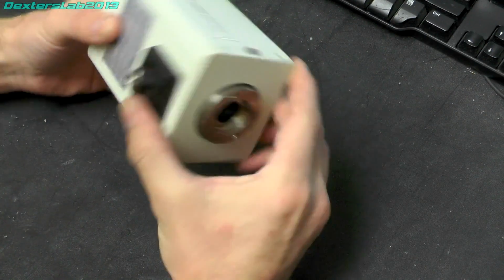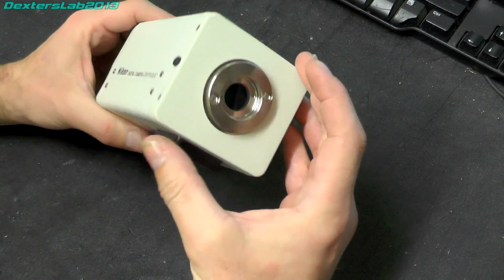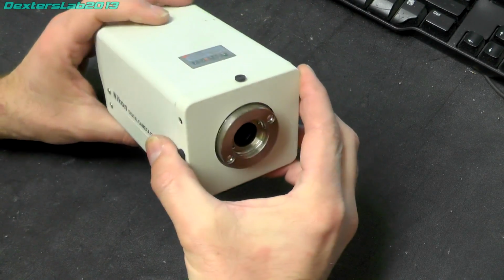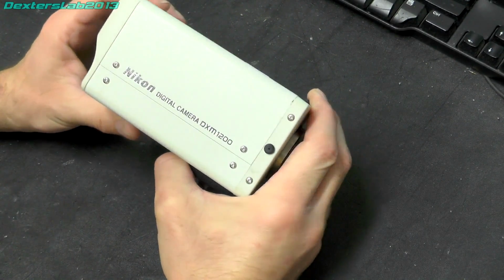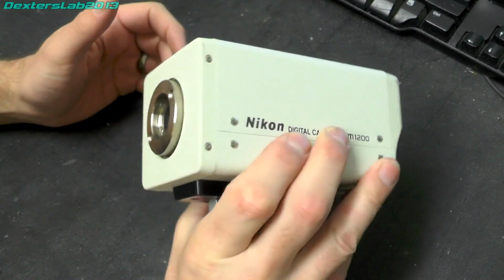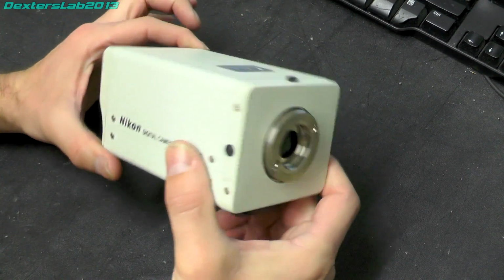So we've picked up this camera a few days ago, and we're going to tear it down and see what it's all about on the inside. Right, so we have here a Nikon digital camera DXM1200. For the keen eye of you, will notice that this does not look like a normal camera, and it's not.